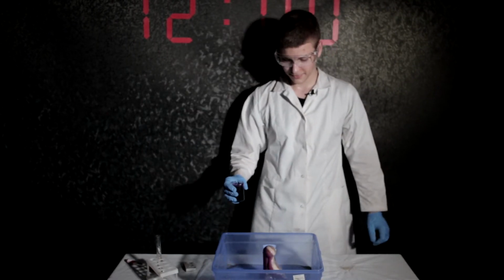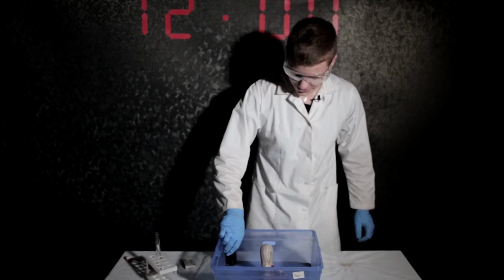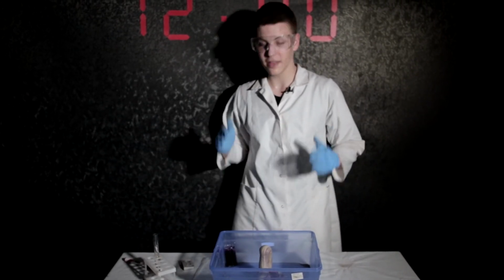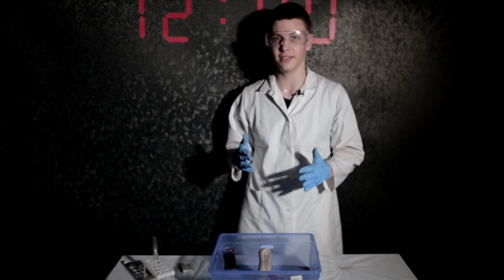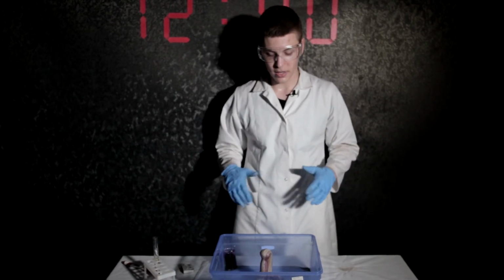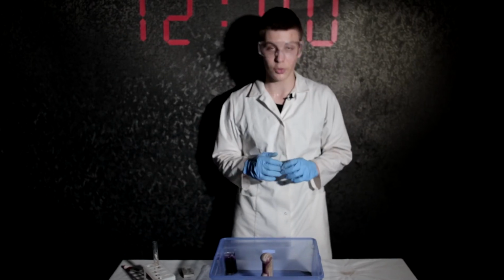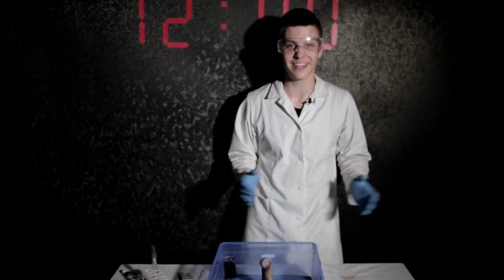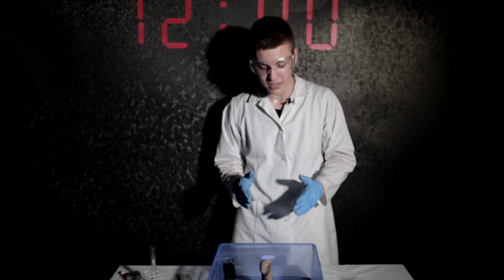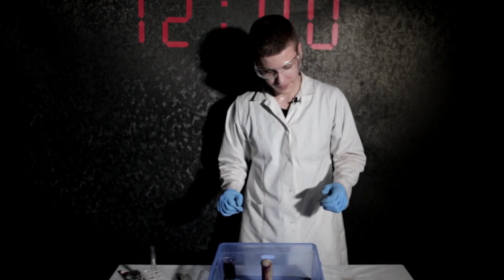Look at that. So, what's the trick here? It's a really interesting equation. It's the equation that I have just explained, but the oxygen was bubbling so much that it made the dish soap make a lot of foam. So there is nothing interesting besides the fact that a lot of oxygen is emitted, and the soap made the foam. Okay, that's it.